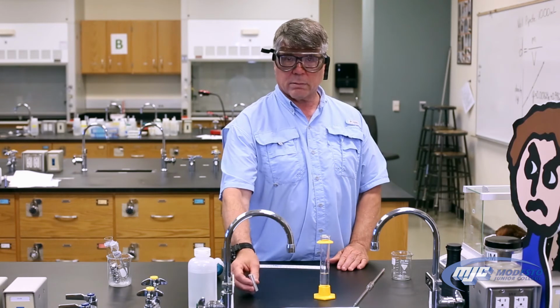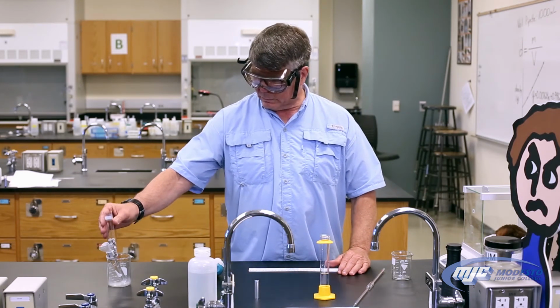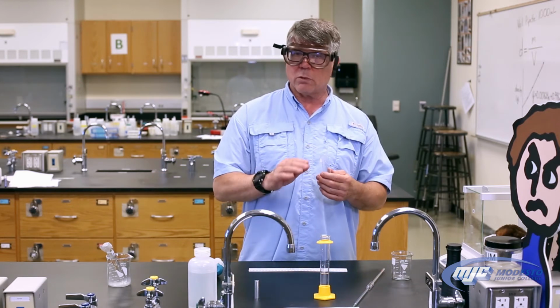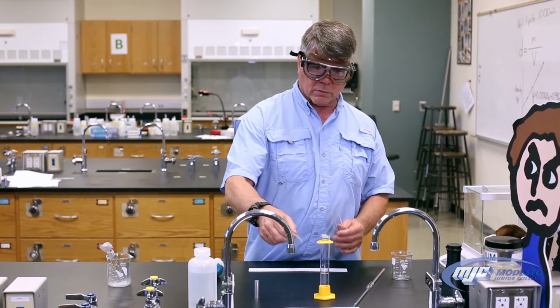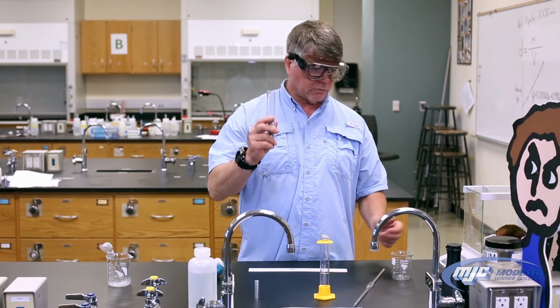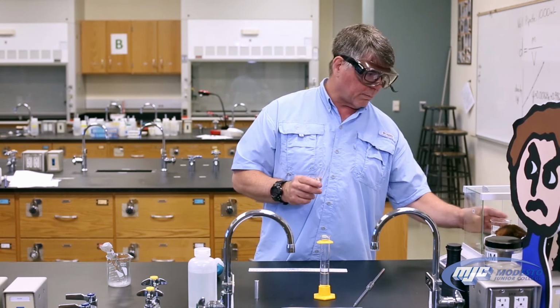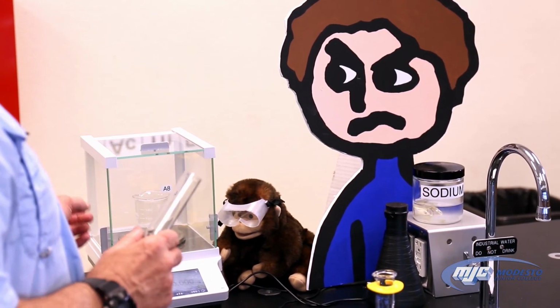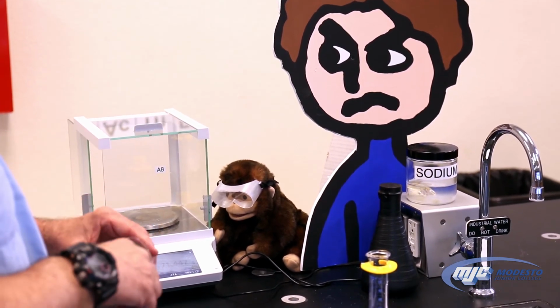Now for part B, the metal shot, we're going to measure the mass. Now with these, if you're getting this data at home, you will not have an unknown number. But if you're actually doing it in the lab, there will be an unknown number. So if you do, take it off and tape it in your data table. To get the mass of the metal shot, you take an empty beaker, place it on the balance, and tare it out, because we don't care how much that beaker weighs. There we go. So now it says 0 with the empty beaker on there.